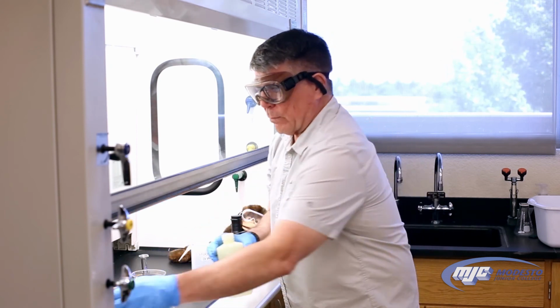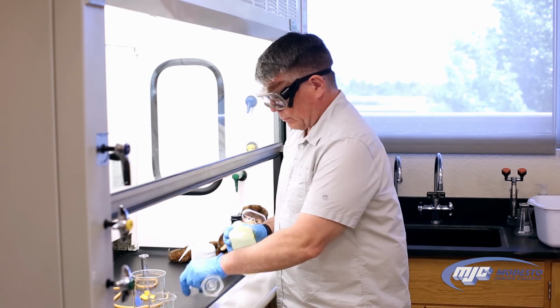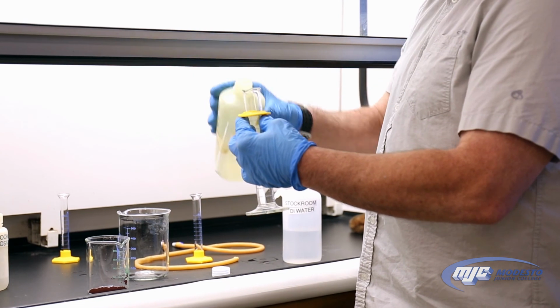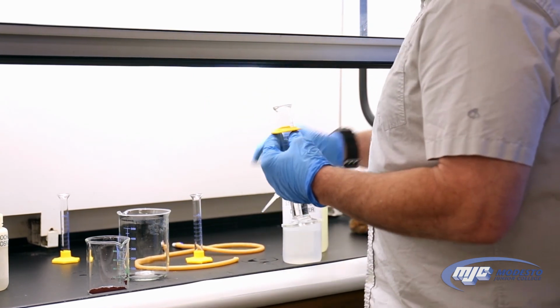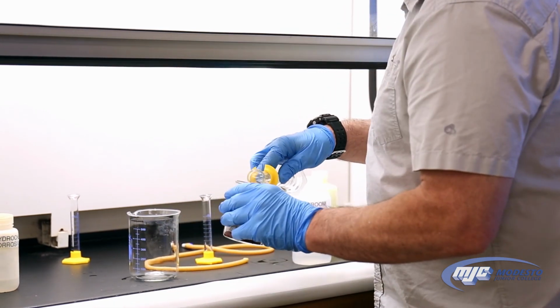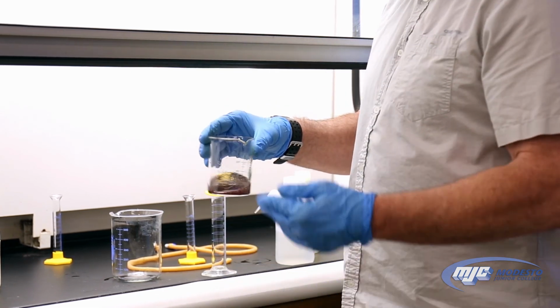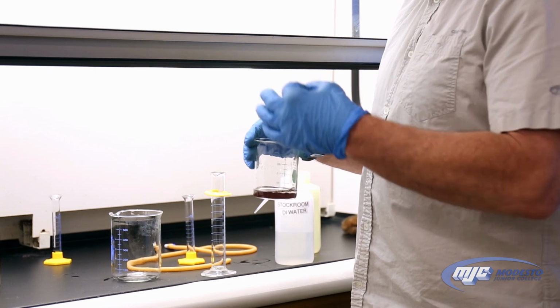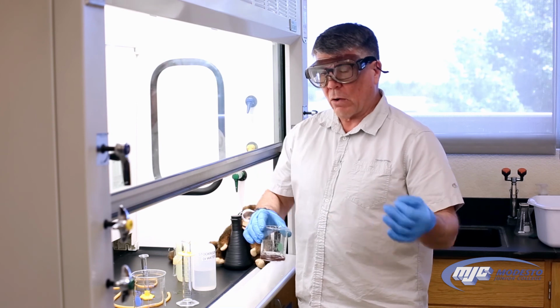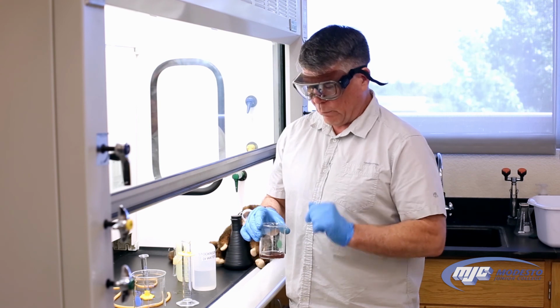So I'm going to take some acetone, nail polish remover basically, and add about 20 mils. The exact volume's not really important, close enough. What this does, guys, is when we rinse it with the acetone, this pulls all the water out, and it's still going to look wet, but it's going to be wet with acetone. Now, when we let this dry over the week in our lockers, the acetone will evaporate easily, and when we come back in a week, that will be dry.